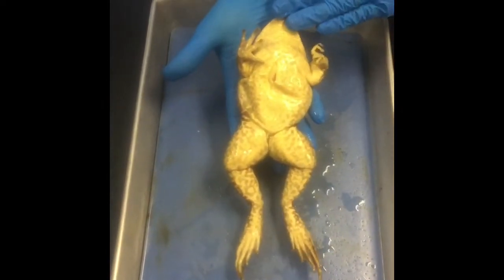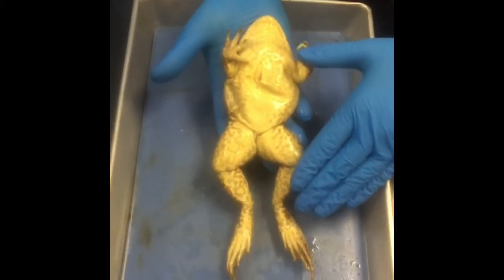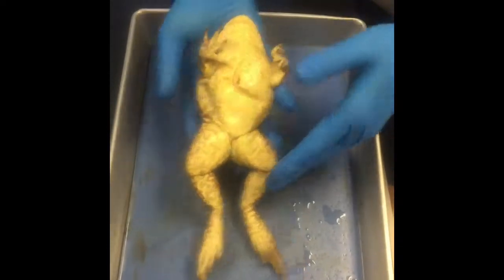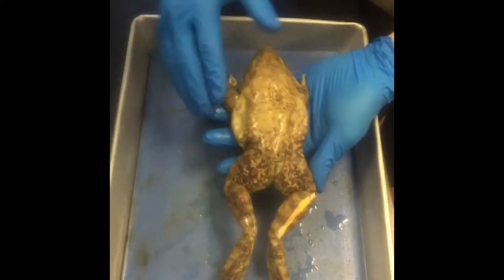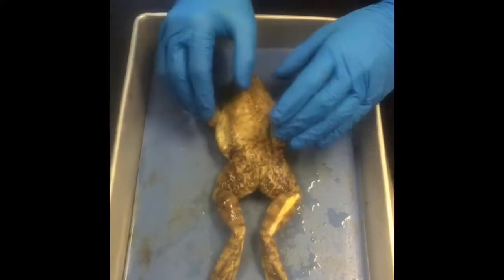The reason is that whenever the bullfrog that lives in fresh water is in the water and a predator or something like that is looking up, it kind of resembles the sky. It's a lighter color, and then whenever it's on the bottom and something's looking down at it, it kind of resembles the ground. So it's kind of a thing of camouflage that it has.